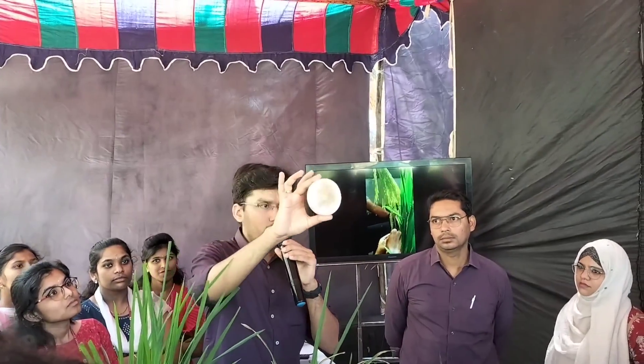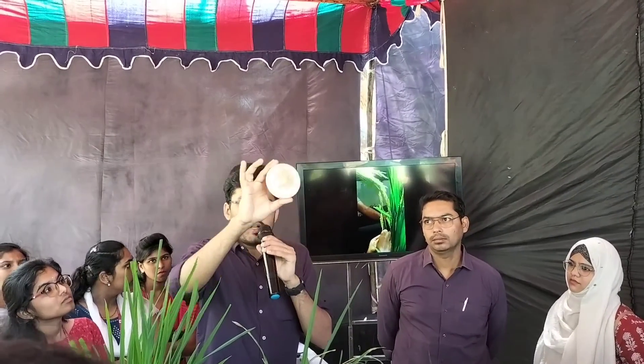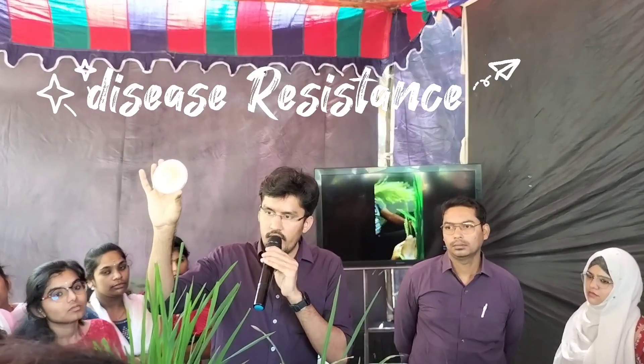Two varieties for example: one variety has your trait of interest, the other is a very widely grown variety but it doesn't have the trait of interest. So you transfer the trait from one variety to the other by doing crosses. We also work on other diseases caused by fungal pathogens. This fungus growing on this plate is called Rhizoctonia solani. Like that, there are many other pathogens that affect rice and we try to characterize how rice can gain resistance against them, so that we can give such varieties to farmers where these diseases are highly seen.